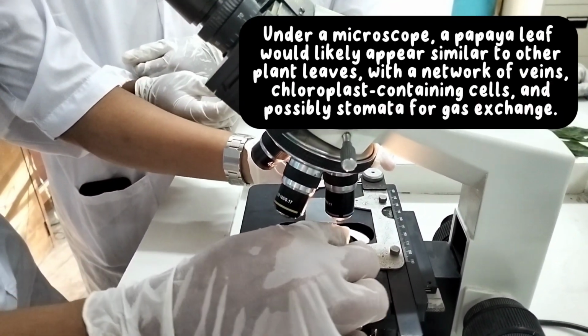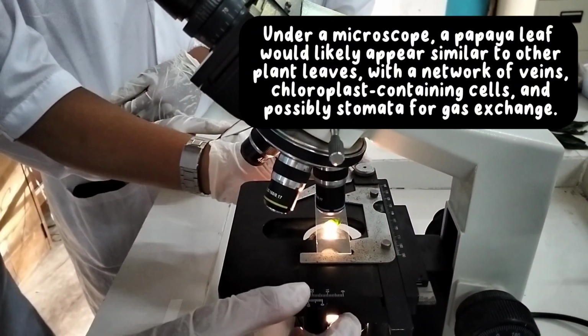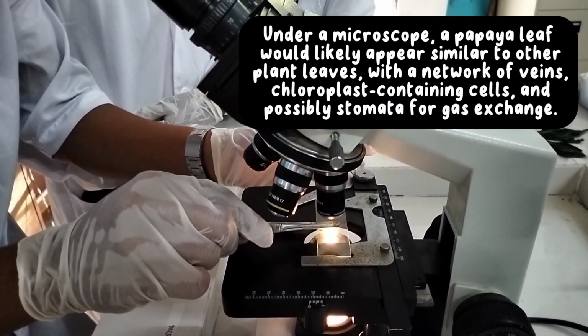Under a microscope, a papaya leaf would likely appear similar to other plant leaves, with a network of veins, chloroplast containing cells, and possibly stomata for gas exchange.